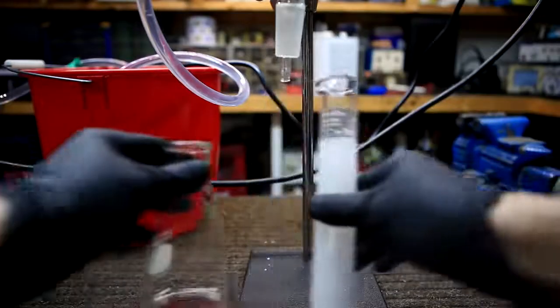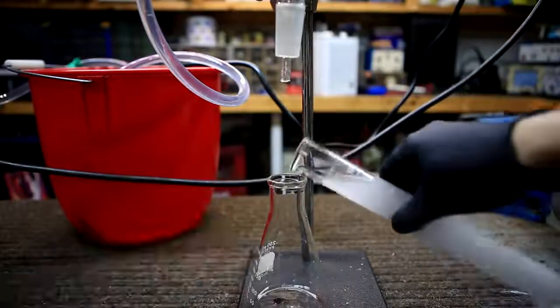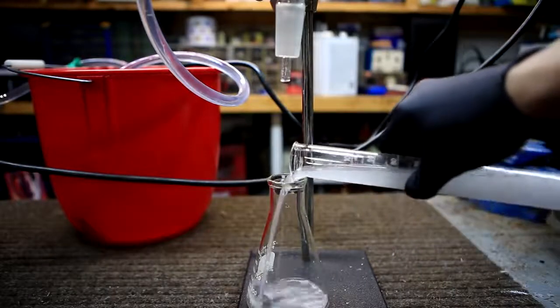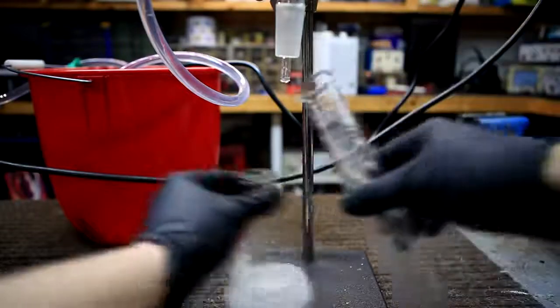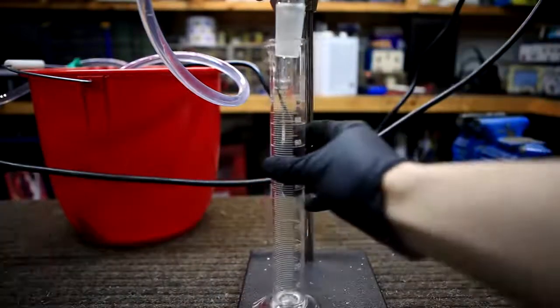After 100 milliliters of this cloudy distillate was collected it was transferred to an Erlenmeyer flask. At this point most of the cinnamaldehyde oil has been extracted but I decided to collect a further 100 milliliters of distillate.